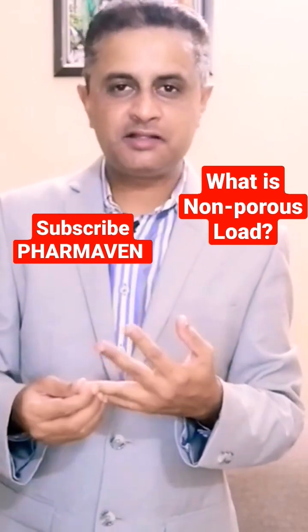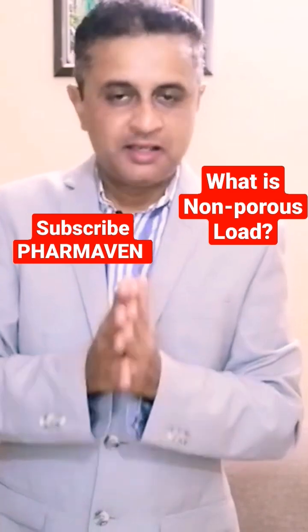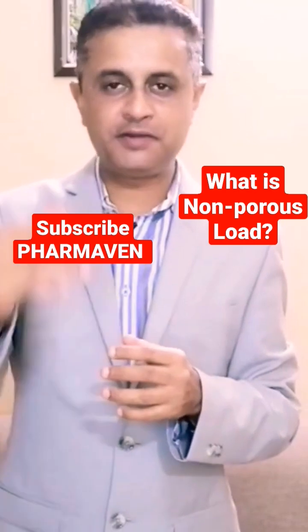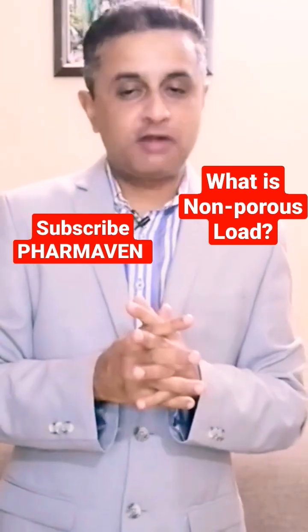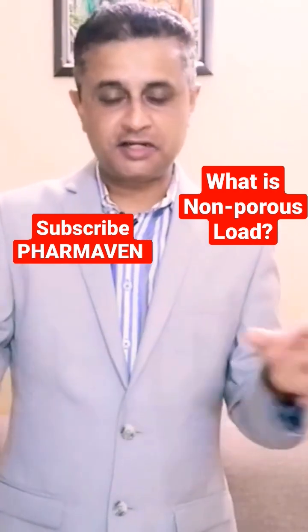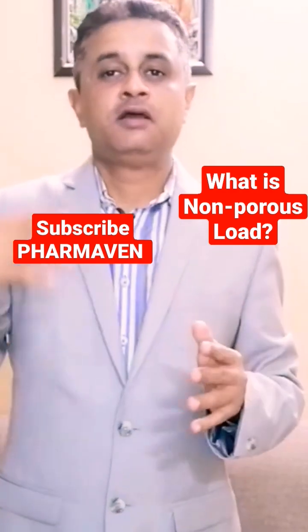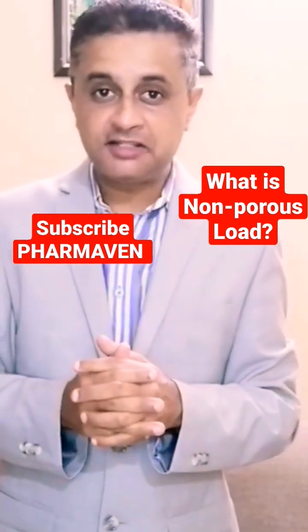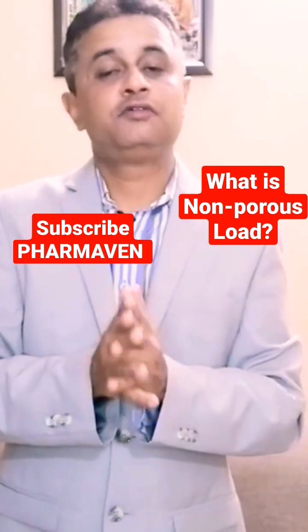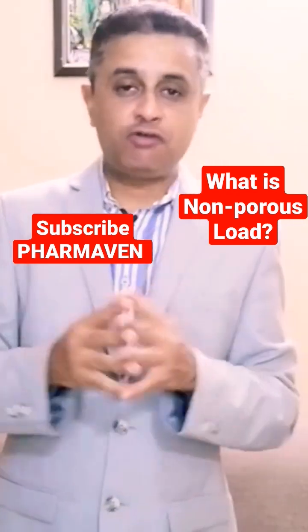It can be metal, it can be glass, or any other solid item. When such loads are kept inside the autoclave, this becomes a non-porous load. Examples include SS vessels, SS filling assemblies connected to tubings, glass bottles, and sanitization loads such as a triple bucket system. All such load items fall under the category of non-porous load.